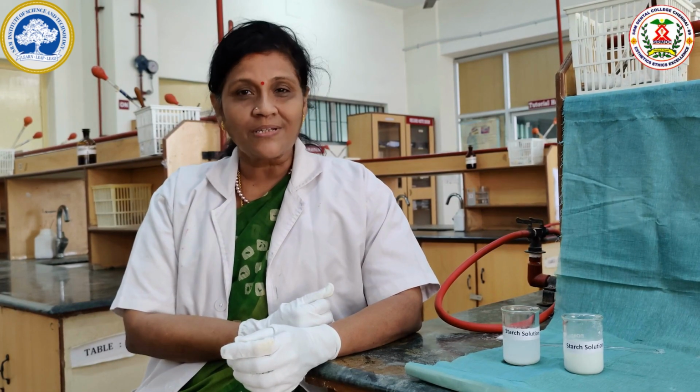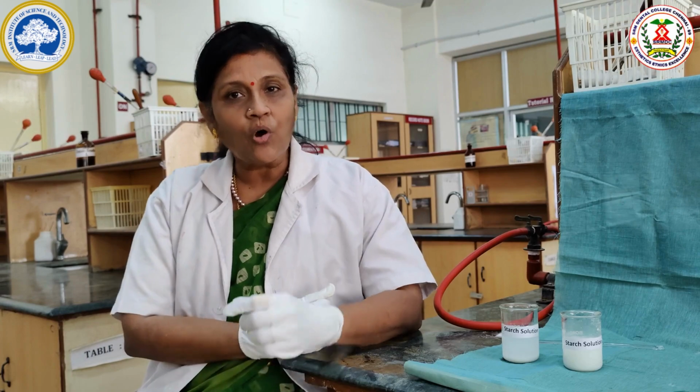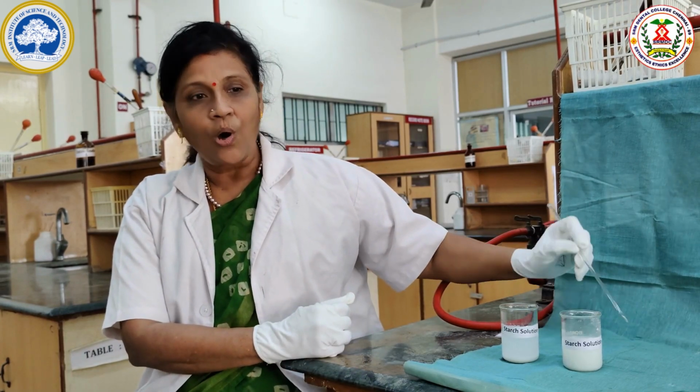In this video, we are going to demonstrate what is starch and how the starch is hydrolyzed by acids. As we all know, starch is a carbohydrate. We take carbohydrates mainly in the form of starch. Starch is formed of two components, amylose and amylopectin.